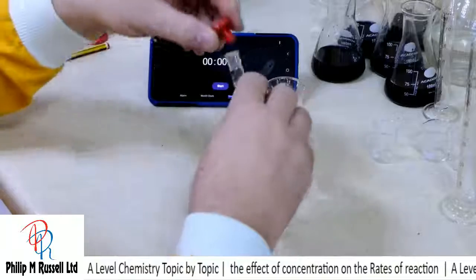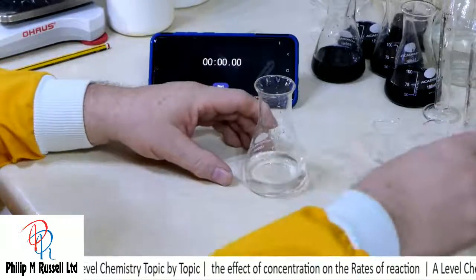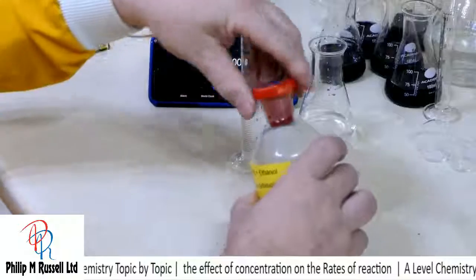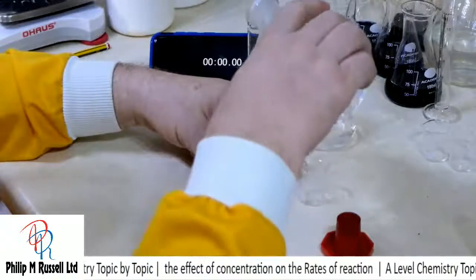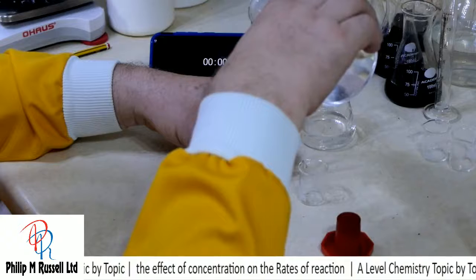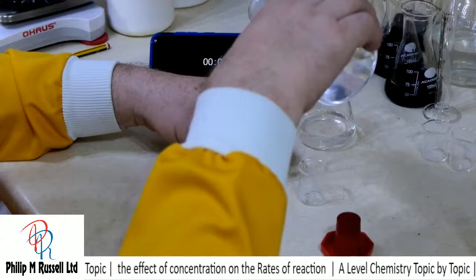The starch indicator actually goes off very quickly. The other chemicals, shelf life not that brilliant, so if we want to try and do this, I have to do it within a sort of a week or two, otherwise the reaction becomes slightly less predictive.